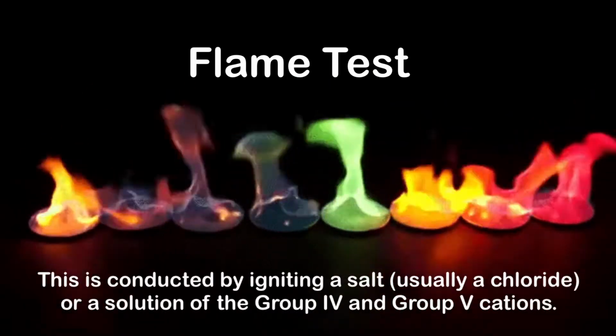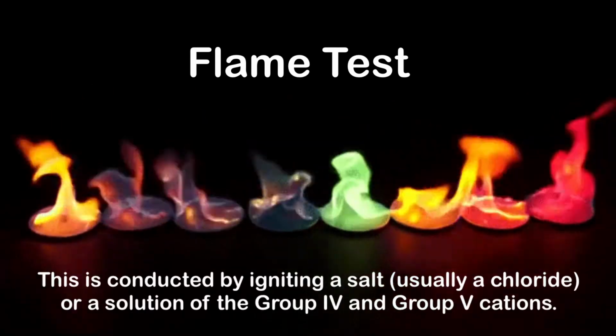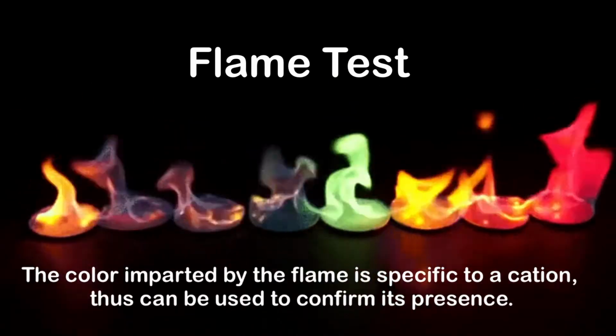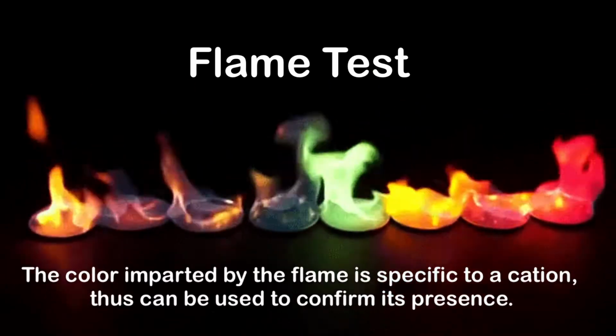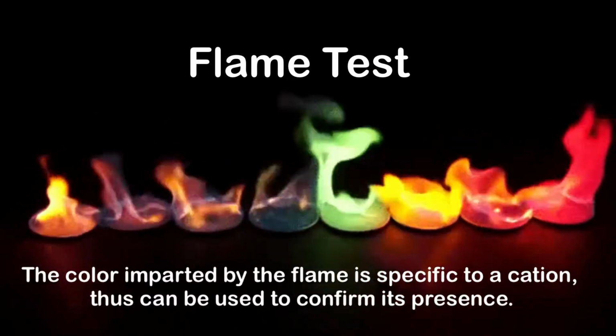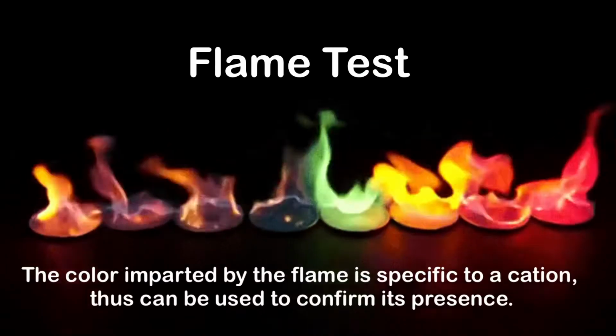Flame test is conducted by igniting a salt or a solution of the group 4 and group 5 cations. The color of the flame after ignition is specific to a cation, thus it can be used to confirm its presence. Let's talk briefly how the color of the flame is produced.